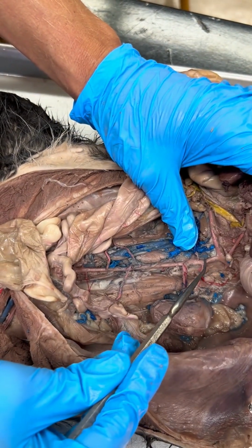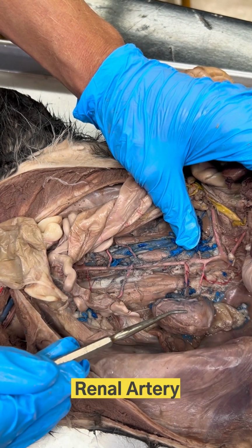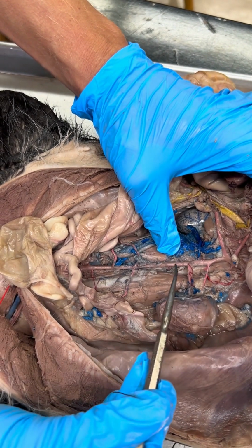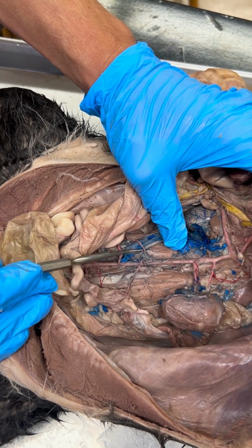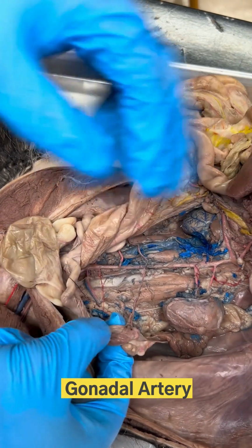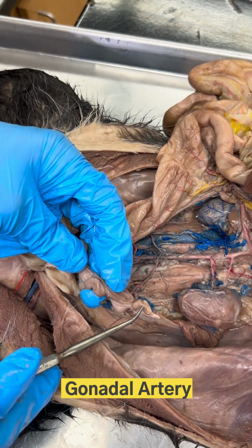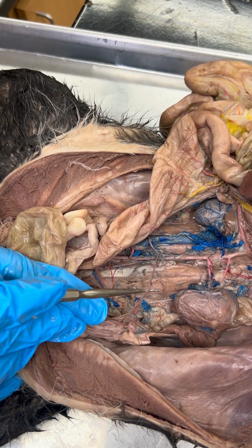As we continue to work our way down the abdominal aorta, the next major branch we find attaches to a kidney. And that makes this vessel right here a renal artery. Continuing down, we eventually find another pair of vessels, this time not going to the kidneys, but instead to the reproductive organs, making these gonadal arteries. So for example, this happens to be a female cat specimen where there is one of her ovaries, and there is that gonadal artery heading to it.